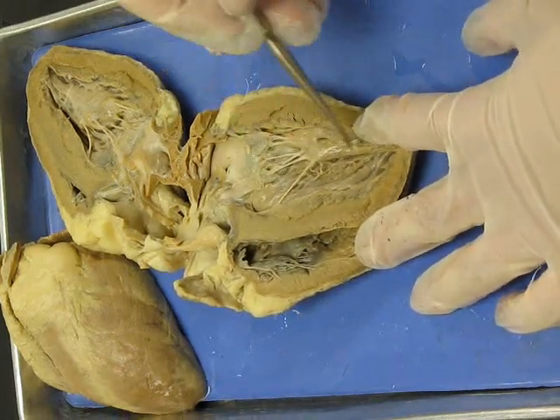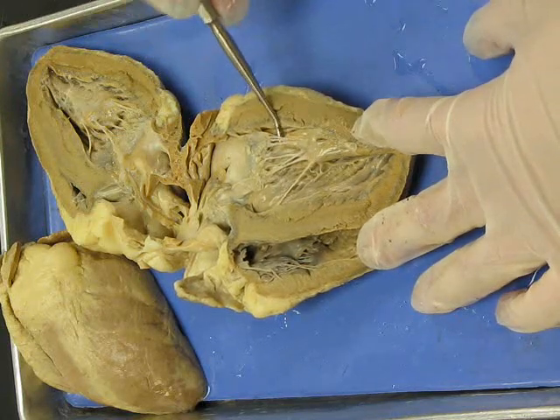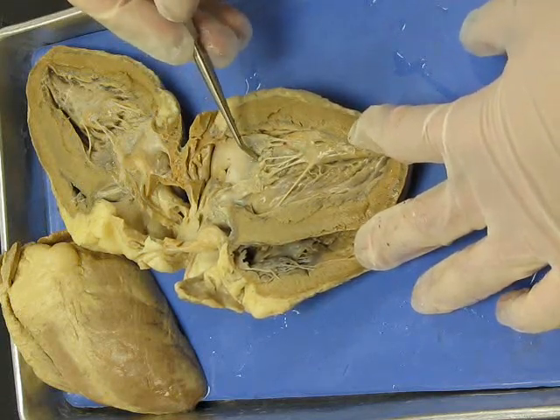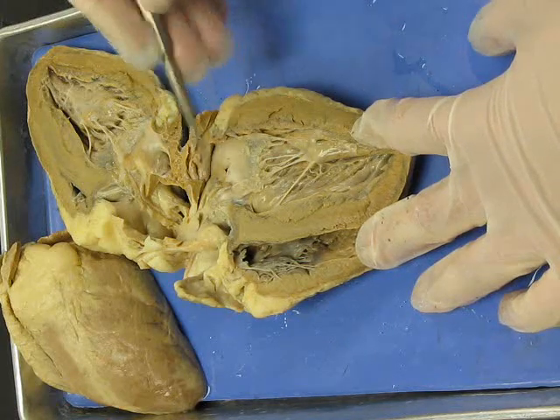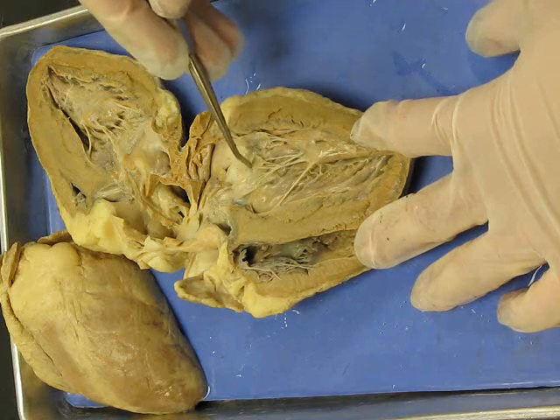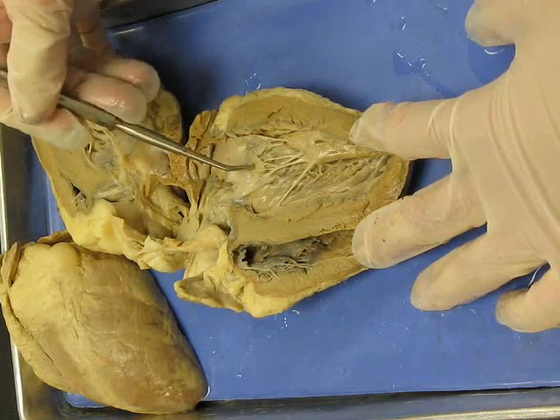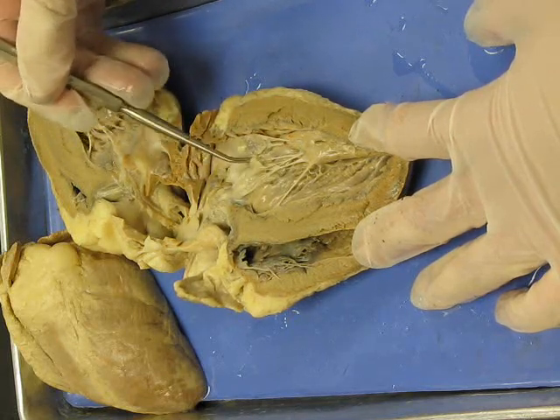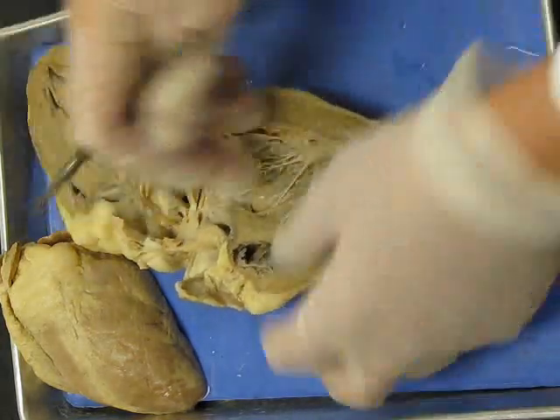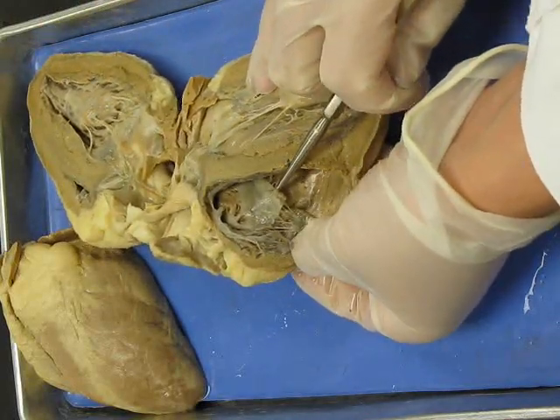You also have papillary muscles of the ventricles attached to chordae tendineae, which are attached to the atrioventricular valves. Since this is the left atrioventricular valve, or bicuspid, or mitral valve. And these valves are made out of cusps. So the structures making a valve are cusps, connective tissue flaps. The name of this valve is the left AV valve. Now on the right side, you have the right atrioventricular valve, or tricuspid.